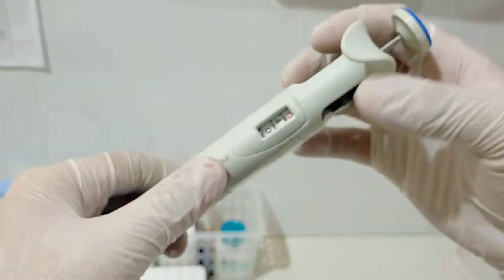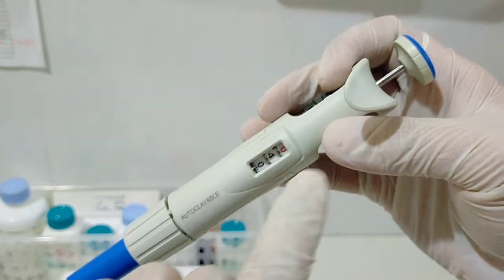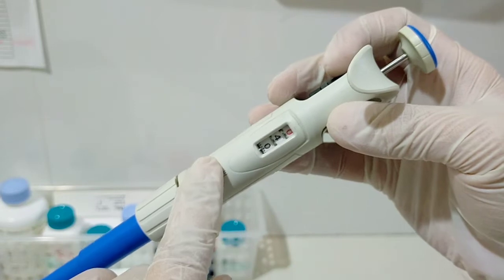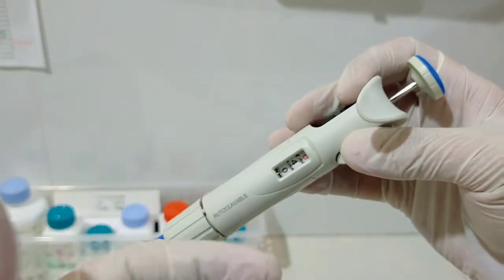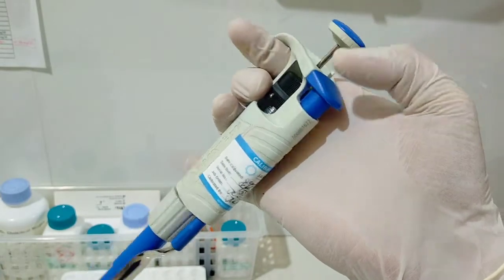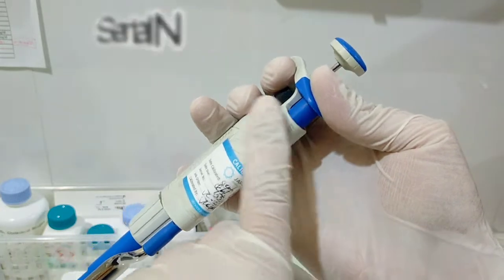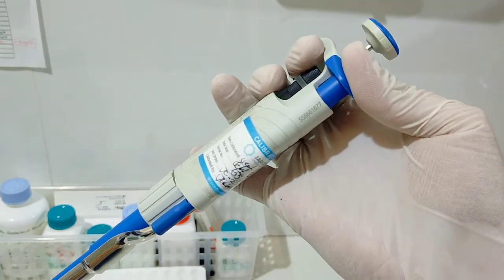The next basic part is the volumeter display. This portion will display the required volume that you are going to aspirate. Next, we have the serial number. This serial number is only intended for inventory purposes.